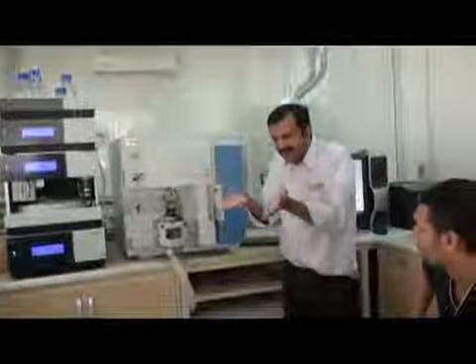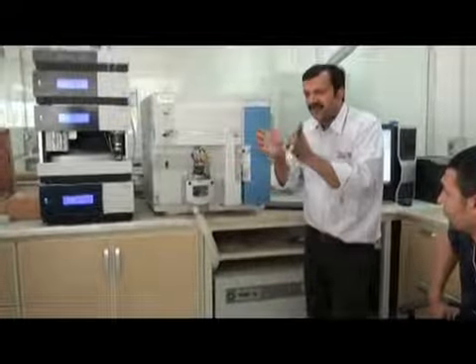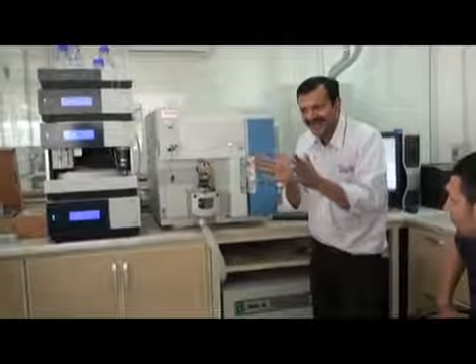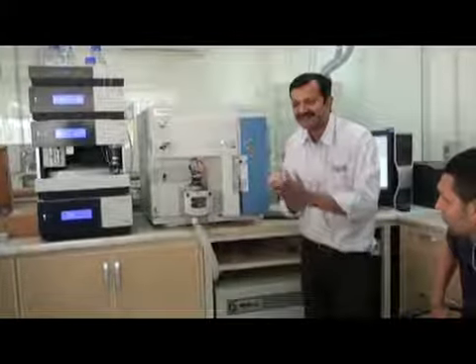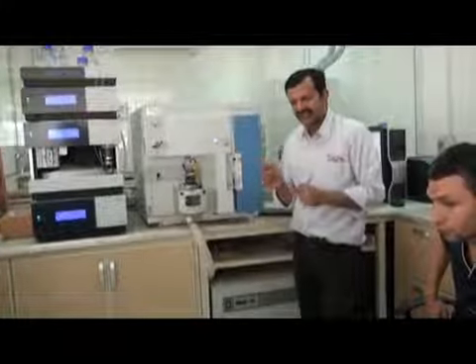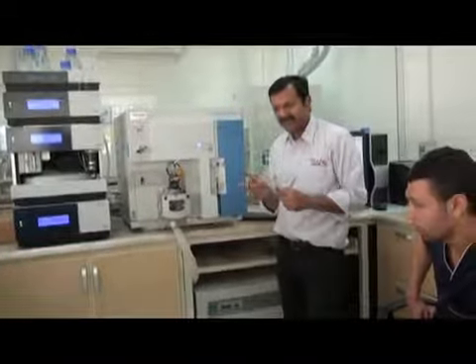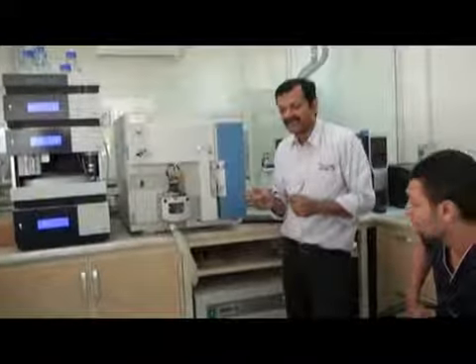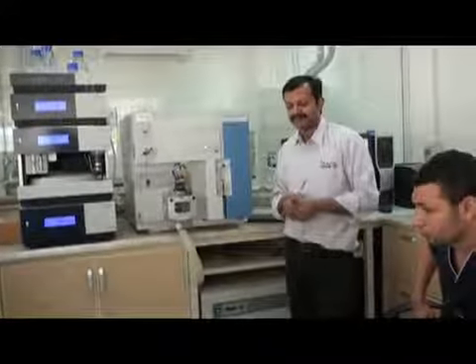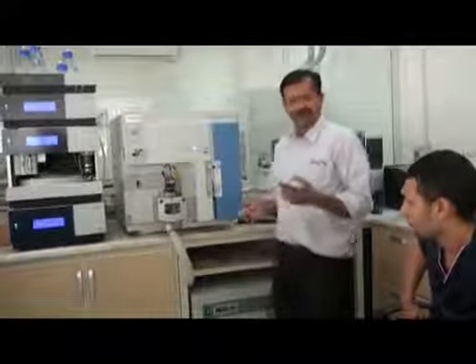Auxiliary gas comes surrounding it, a little bit outer covering, because the spray may go maybe like this. So the auxiliary gas will cover it and control it. Okay? So the spray will remain in this direction. It's called sheath gas, SHEATH. Sheath gas and auxiliary gas. AUX, you can write down only AUX, it is important. We will see it here. Everything we will control here. Okay.